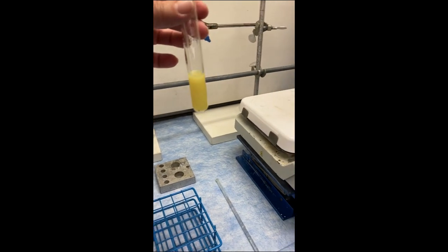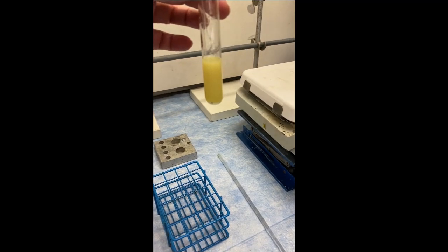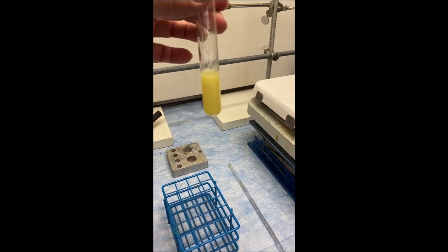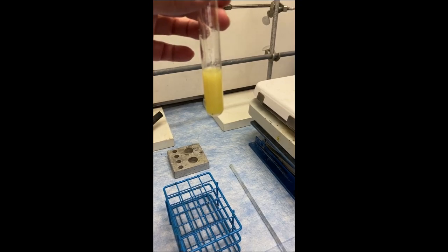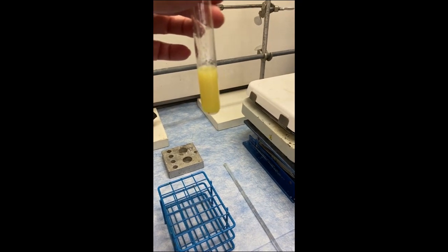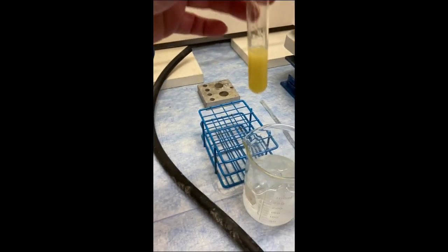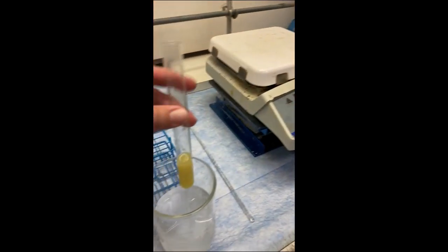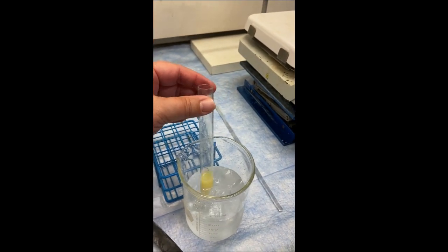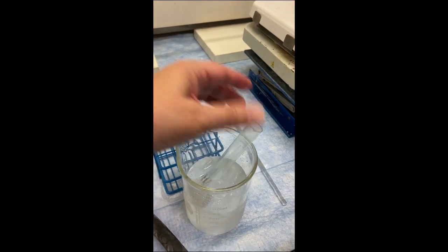Why are we going to do that? Solubility is directly related to temperature, so when we put it into the ice bath, the solubility of our compound will decrease with decreased temperature, and that way we can get more of our crystals to come out. This is a rough crystallization, so we're making a crude crystal first, then we'll recrystallize it in a little bit.